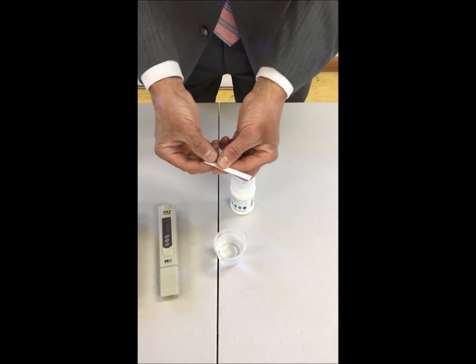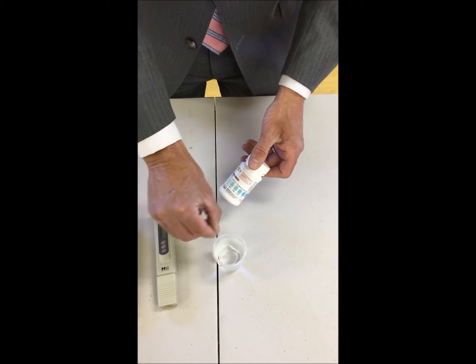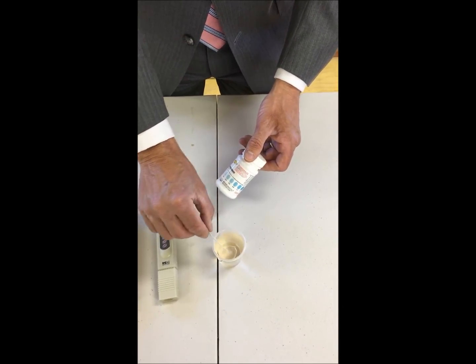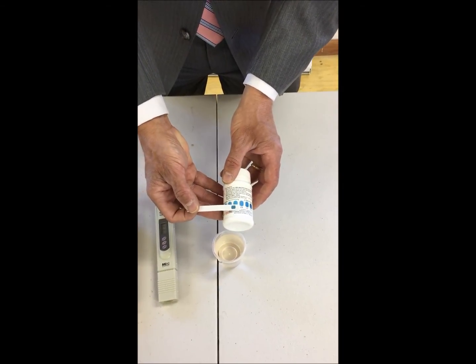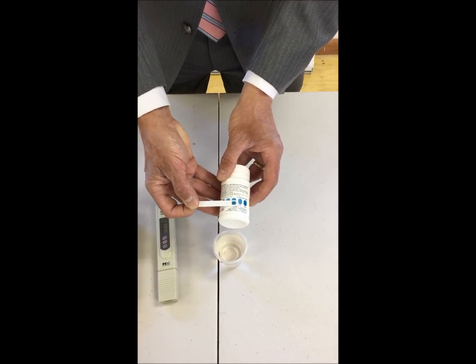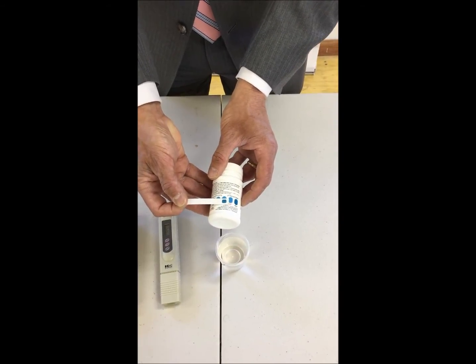You take one of these sample dip slides out of the kit, dip it in and shake it back and forth, approximately 20 seconds. In this case, we put a little extra chlorine so we can see it easily for you. And then compare that color to this chart. In this case, we're showing something around, I'd say 2.6, right about there. That would show a high level of chlorine at 2.6, which we would then note in our log sheets.